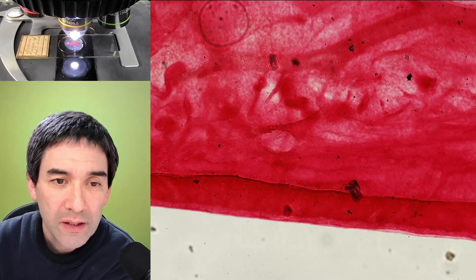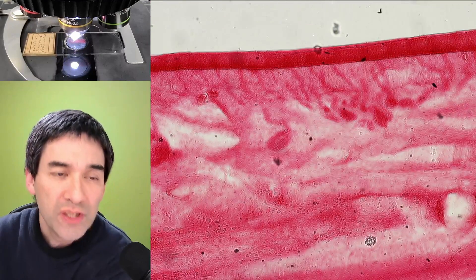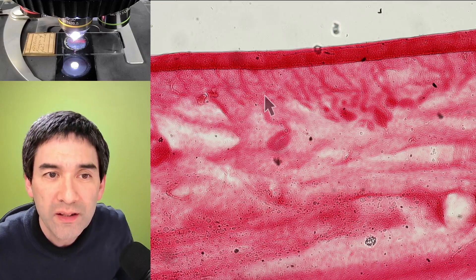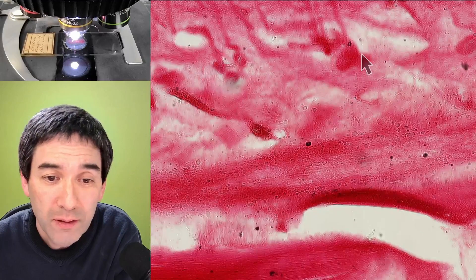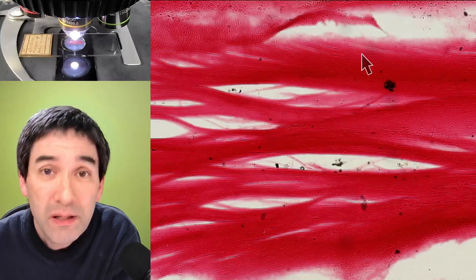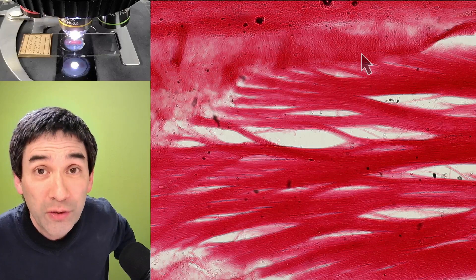It's very dark now and some of the structures are not quite as easily visible. But I'm happy that the specimen was still able to withstand such a long time — I'm very glad I actually got this specimen. You can actually see some of the glands here just beneath the skin, and there are some ducts — probably some sweat glands or oil glands — and basically this here is the skin. Even though it's not a very nice thought, considering that we're looking at a human being who lived over 100 years ago, I consider it from a biological and scientific perspective quite fascinating.